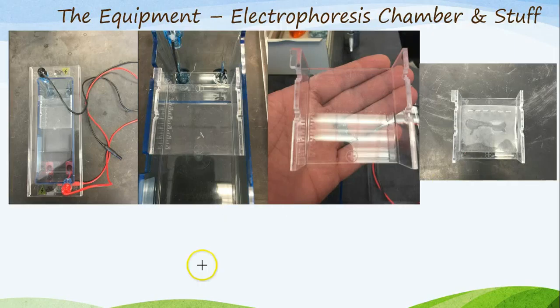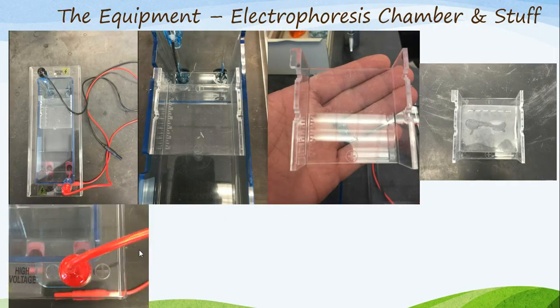From there, you're going to take that tray and you are going to place it back in the chamber with the gel on top of it. So basically, what you need to know is that this bad boy right here gets put right back into this chamber. They've also dummy-proofed this process. There are two places in which you can place your tray. These chambers are designed to have not one, but two gels run in them at the same time. However, you're so special. Your teacher has designed this so you, by yourself, as a group, can run just your own gel in your own chamber.